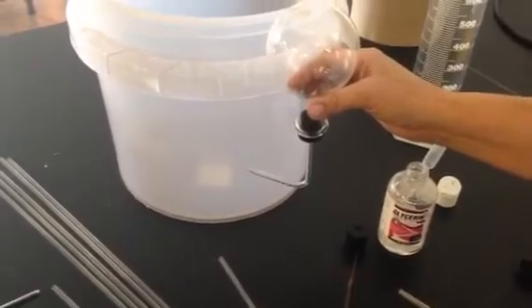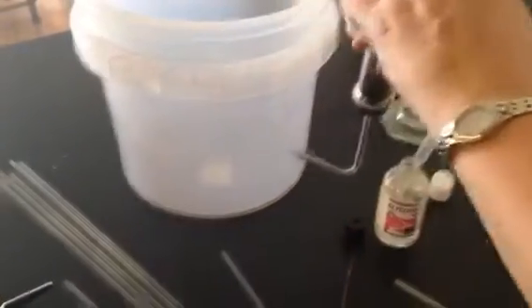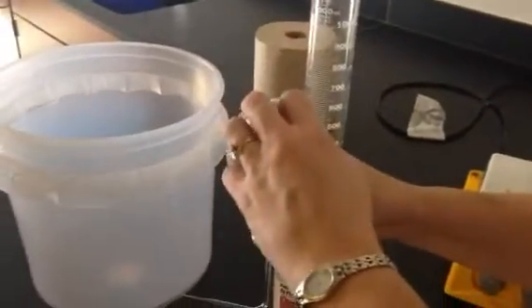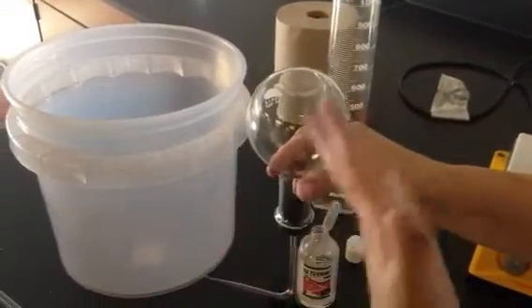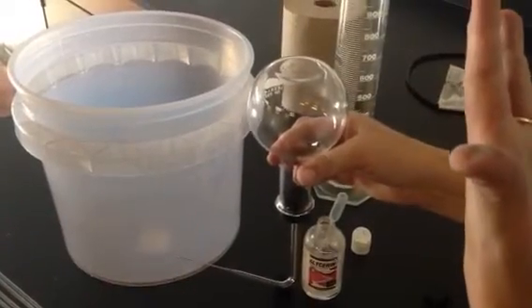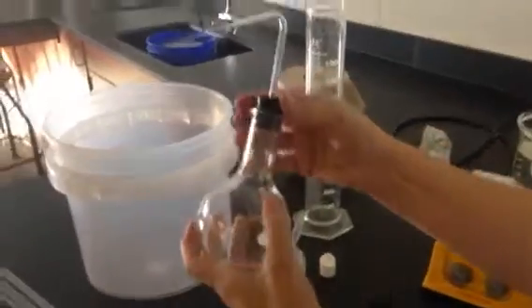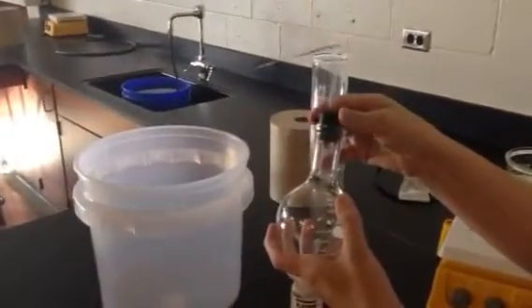If you did a good job sealing it, water will rush in because the liquid or the gas that we made from the liquid has condensed and there's almost a vacuum inside of here. And the water rushes in to take that place. Once there's water in here, you've got to work off the stopper. Part of the water is in there and we want it all.